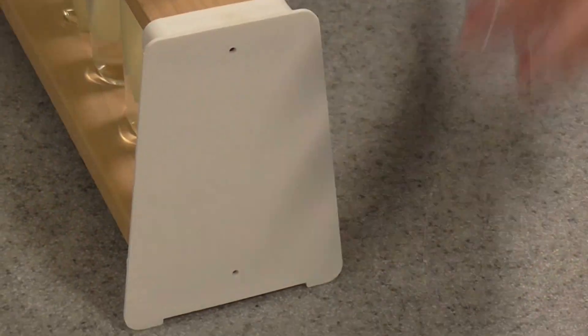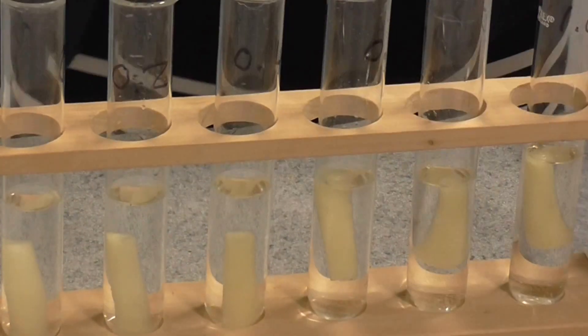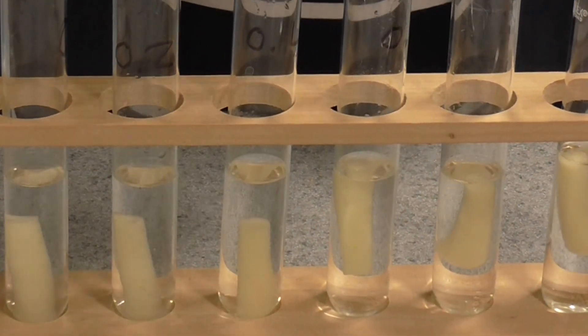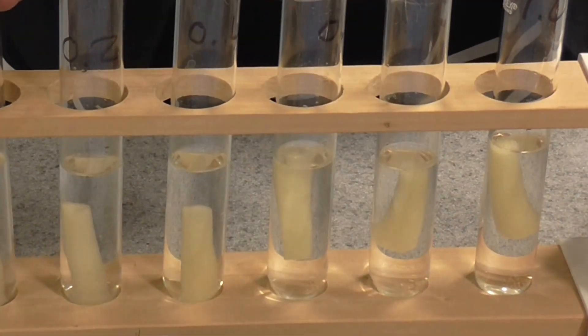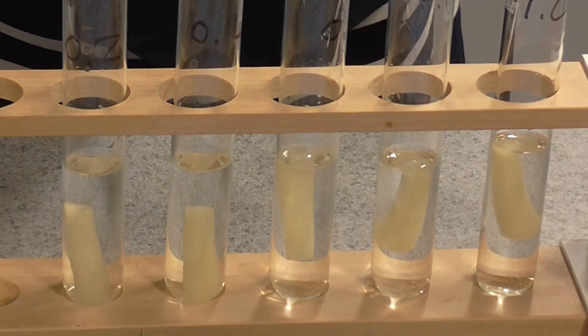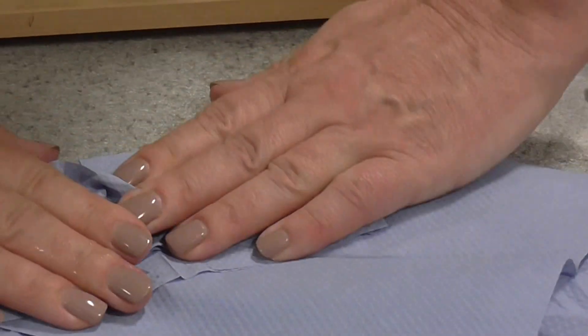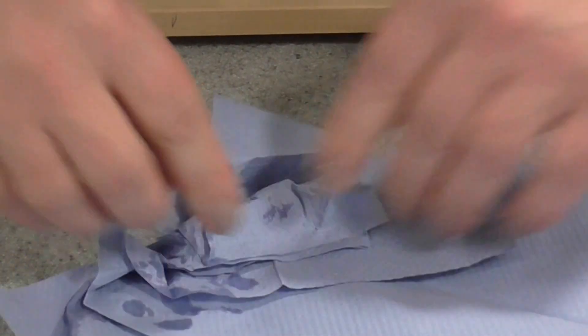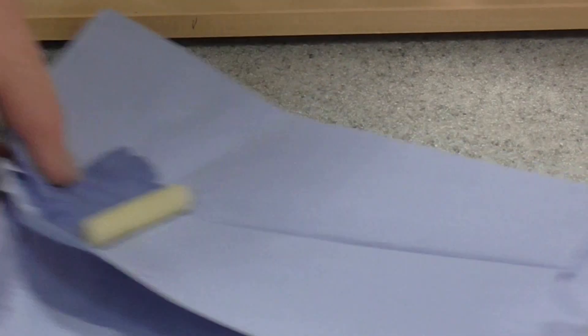After 20 minutes, return to your water bath and you'll see I've already done this. They all look very similar, but we now need to actually make our results very quantitative. So what we're going to do, we're actually going to remove the chips and just like before, we're going to blot them dry. So I'm going to remove that from the solution. Make sure you've thoroughly blotted it dry and do that for all of the chips. We want to remove any excess water from the surface. Then place them back in the same weighing boats that you labeled at the beginning.